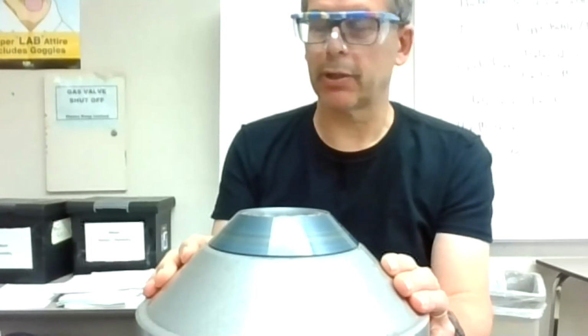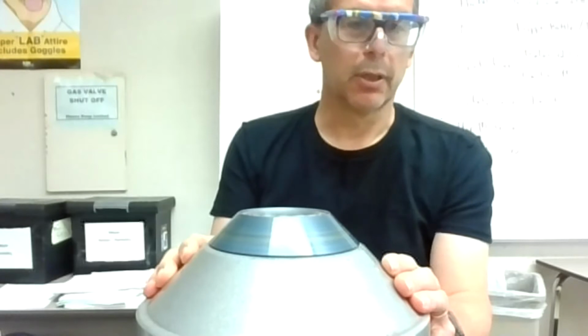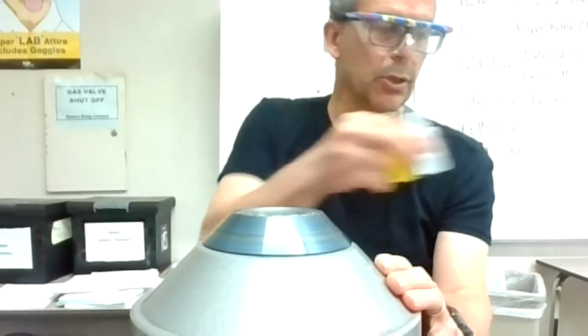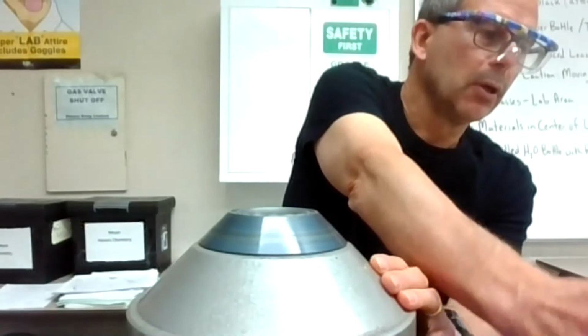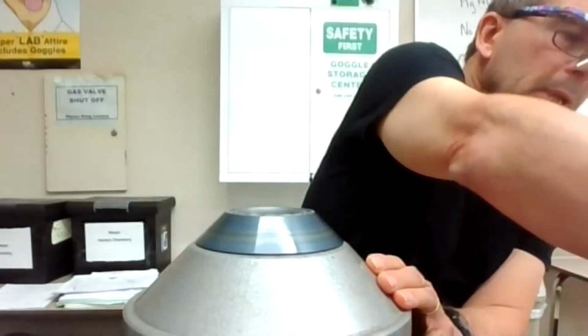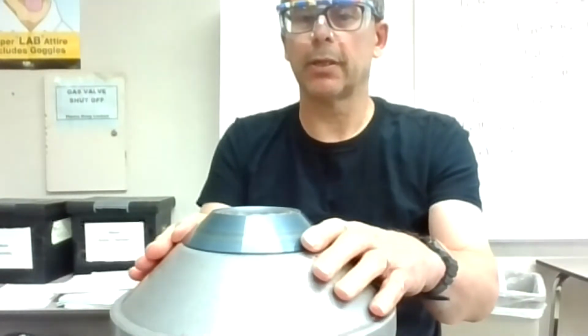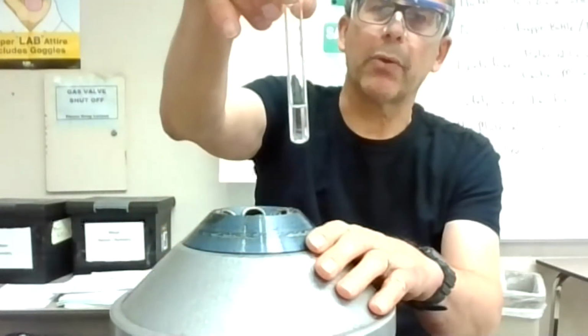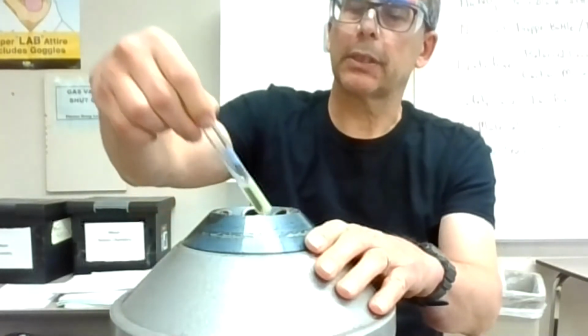Again, probably give it a little bit of extra time in the spinner, then I won't have to redo it. Okay. And that one looks pretty good. Okay, so spinning that around and getting ready for my next test, which is SO4. All right, I think that's good. Pull this out, and that's my blank with the water. Let's see how we did.